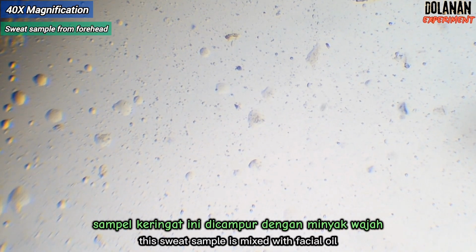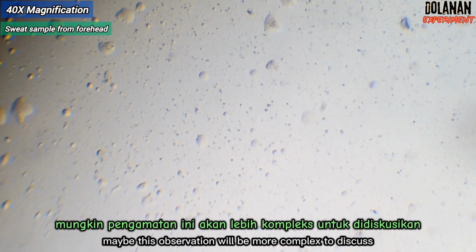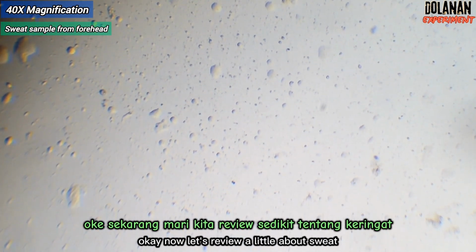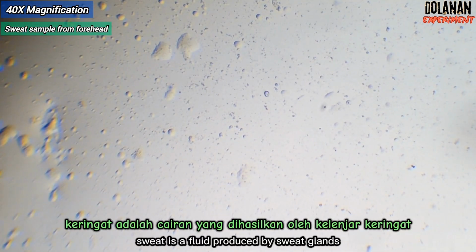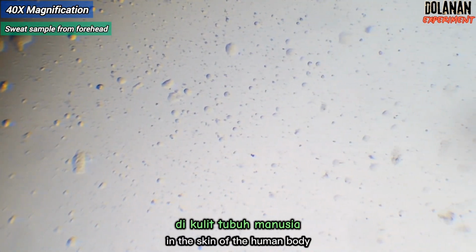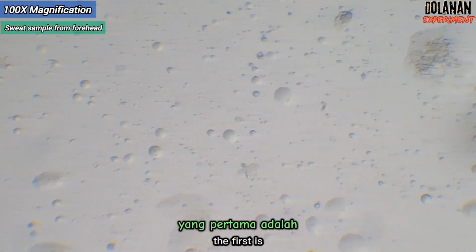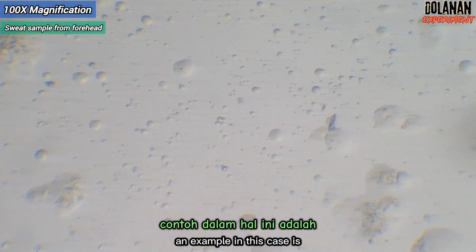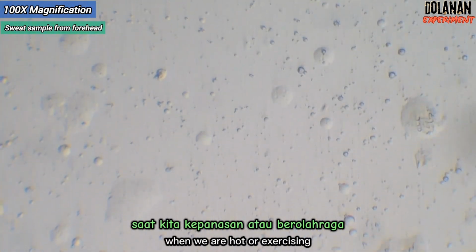This sweat sample is mixed with facial oil and a little dead skin cells. So, maybe this observation will be more complex to discuss. Okay, now let's review a little about sweat. So, what is sweat? Sweat is a fluid produced by sweat glands in the skin of the human body. Sweat has several functions for our body. The first is, sweat functions to regulate body temperature. An example in this case is, sweat helps lower body temperature when we are hot or exercising.